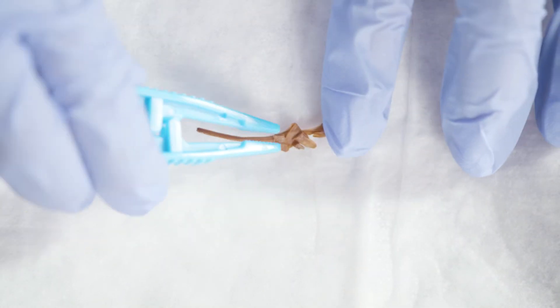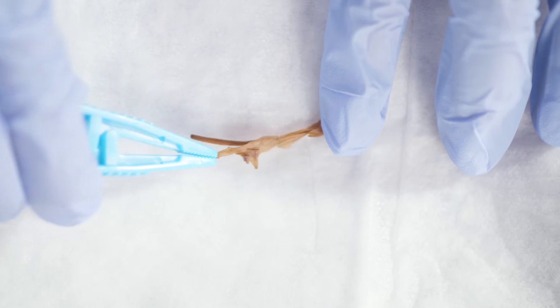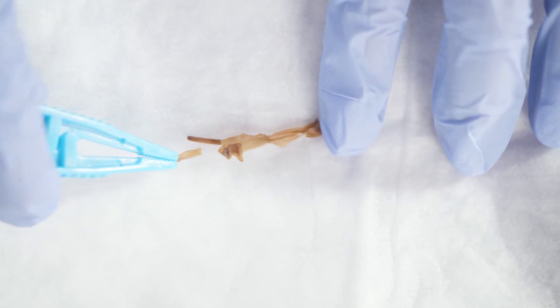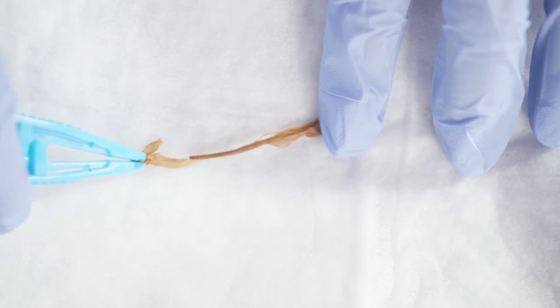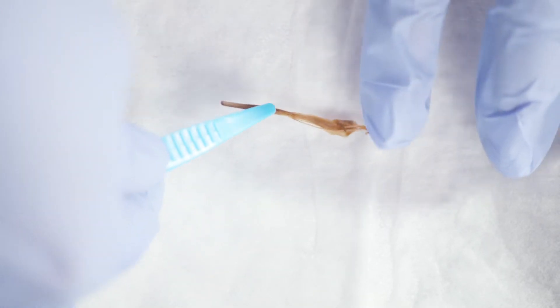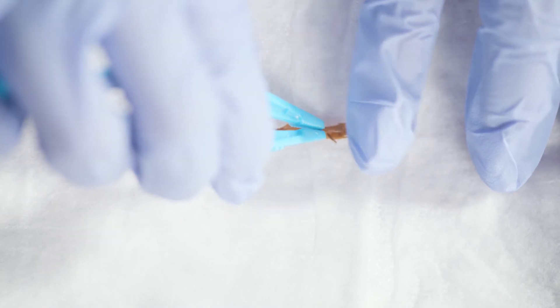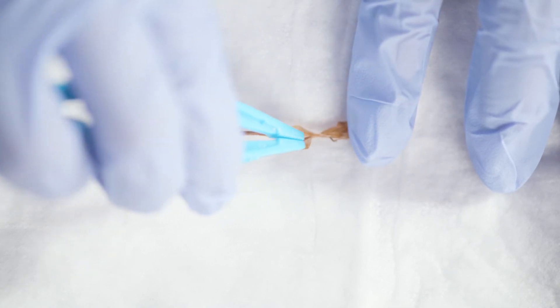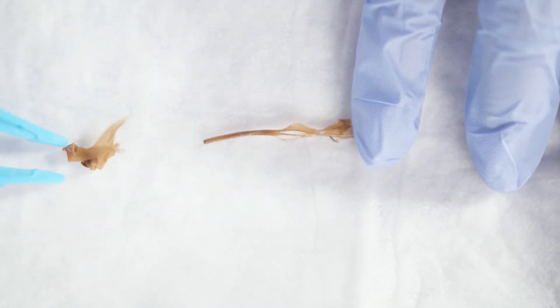The honeysuckle flower is one of the specimens where it may be difficult initially to identify the ovary. As you carefully peel away the petals, you will see the length of the pistil continue down into the receptacle. Note where the petals begin to widen around the pistil. This is where the style ends and the ovary begins.